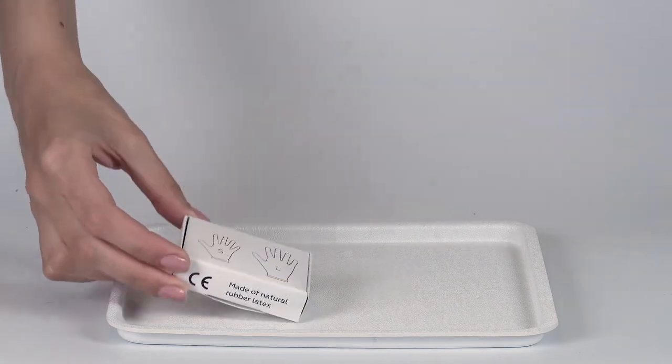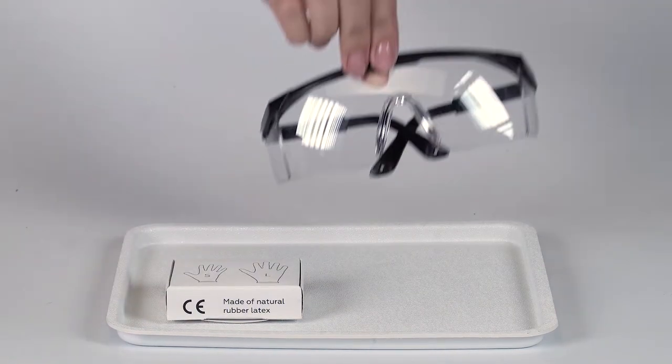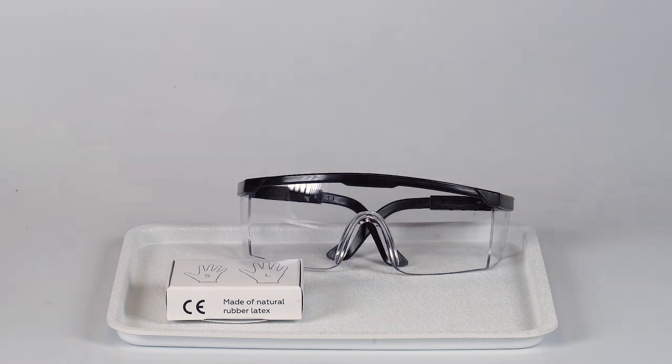Perform the experiment on the plastic tray to contain any possible spills. Do not forget to put on protective gloves and goggles before doing the experiment.